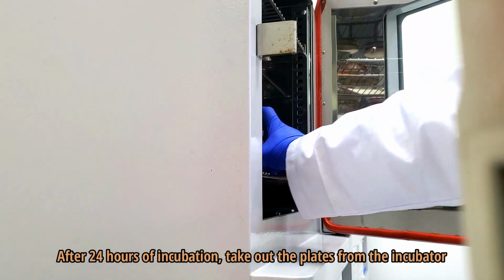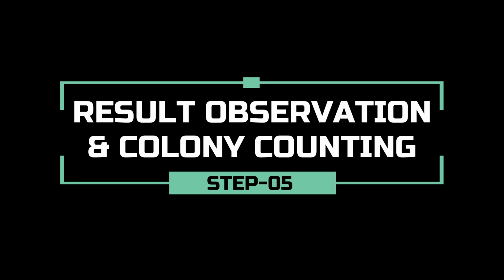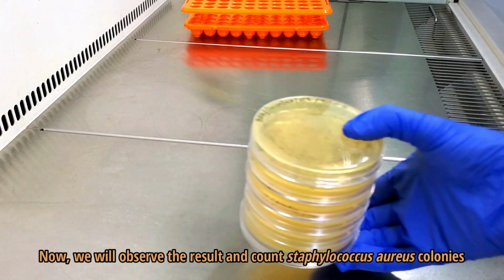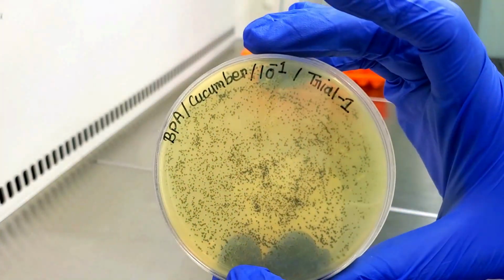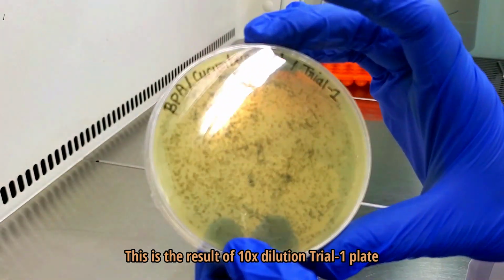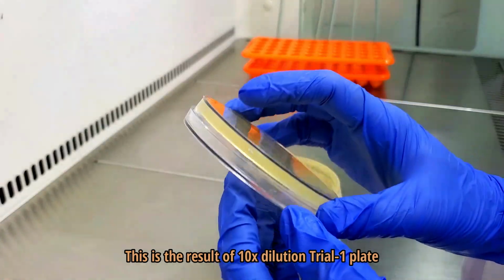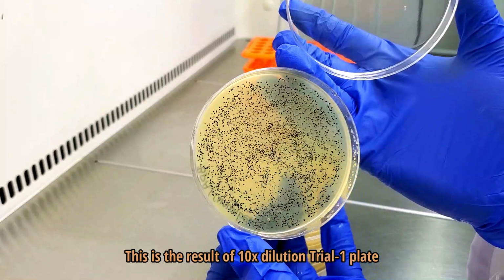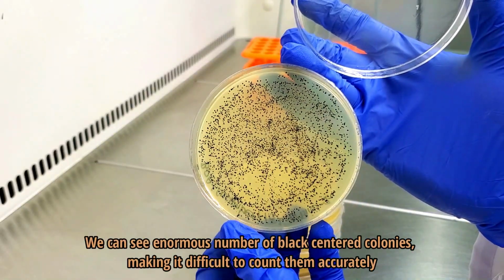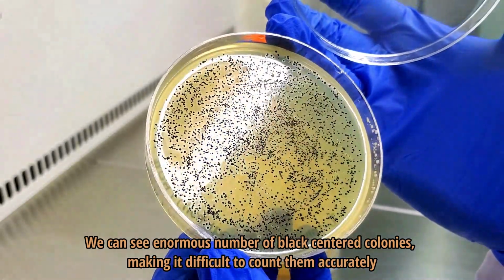After 24 hours of incubation, take out the plates from the incubator. Next, we will observe the result and count Staphylococcus aureus colonies. This is the result of 10 times dilution trial 1 plate. We can see enormous number of black-centered colonies, making it difficult to count them accurately.